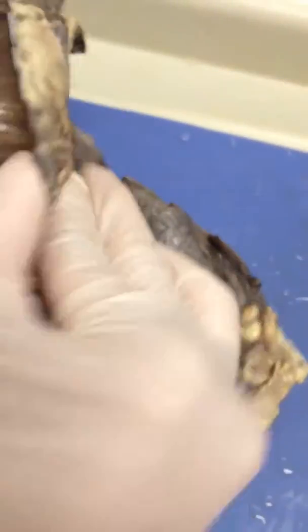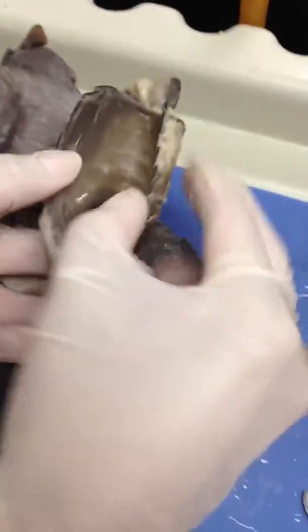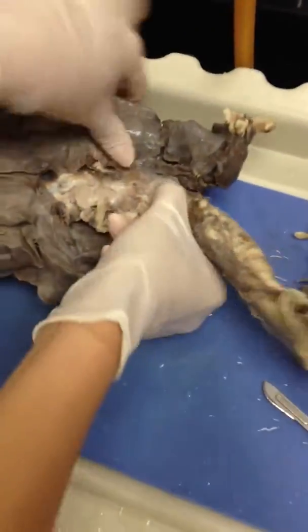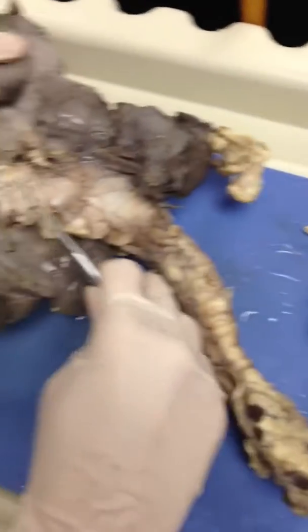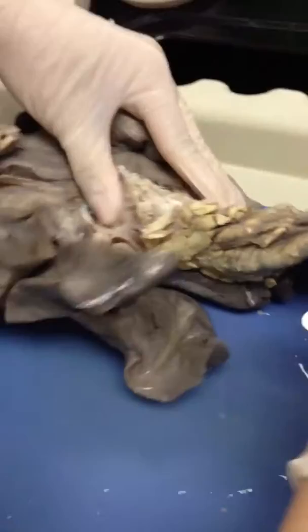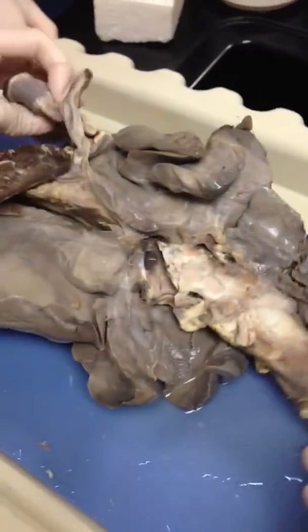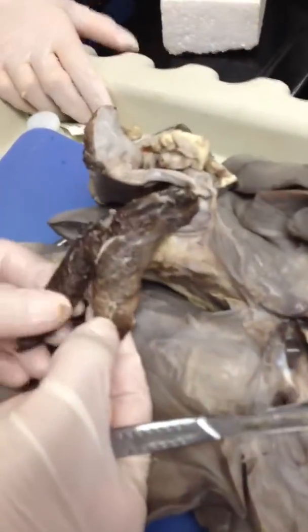Make sure you have a glove if you want to try that. The trachea then divides into the main bronchi. The main bronchus is the first part where you can feel the cartilage entering the lungs. Before we see that, what is this tissue or structure here that looks like steak? The diaphragm. This is the diaphragm.